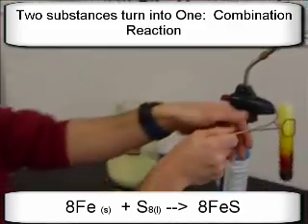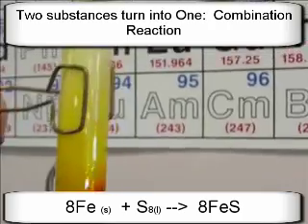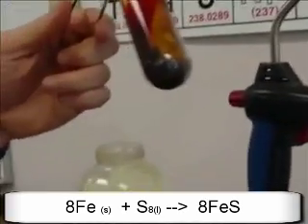Now, if you zoom in, you can still see some of the swirling hot gases there, can't you? That's vaporized sulfur up there. Lovely. I like that red. That's pretty cool. Okay, now here's the thing that's interesting about it.